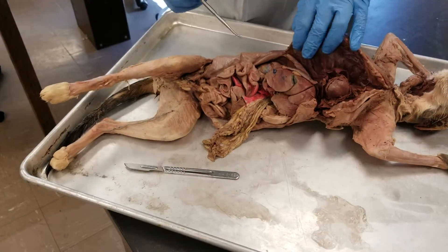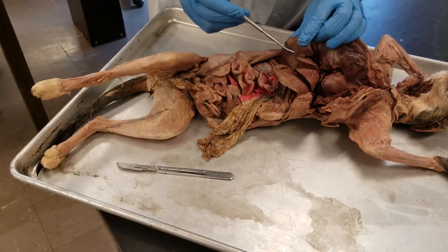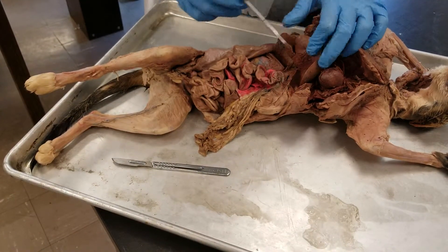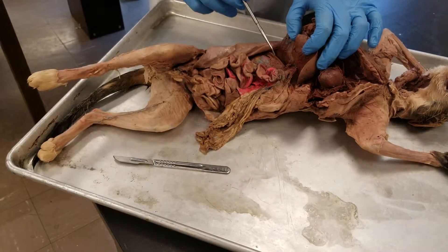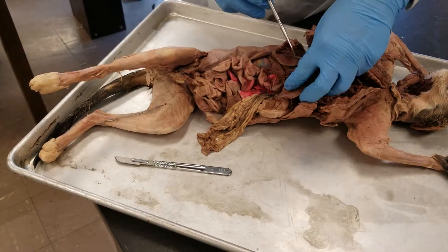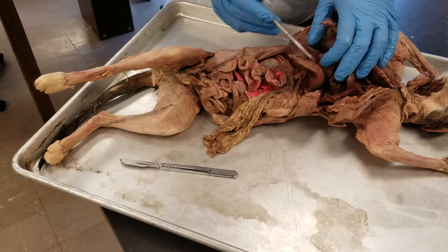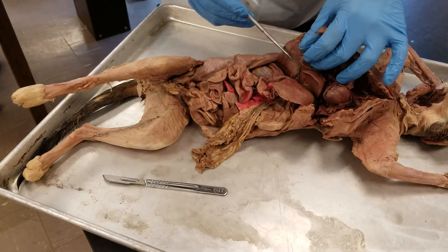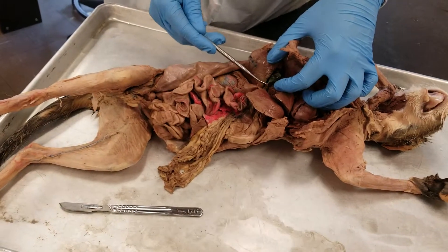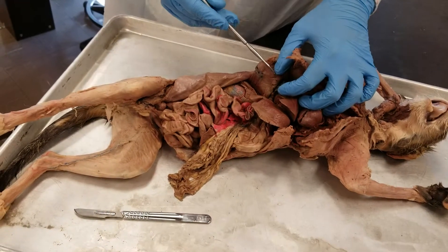Then we have the liver and each of its lobes, which is here. This is the liver — those are the main lobes of the liver. Then we have the gallbladder, which is this dyed green piece here. This green dyed piece right here is going to be the gallbladder. That is the duct for the bile.